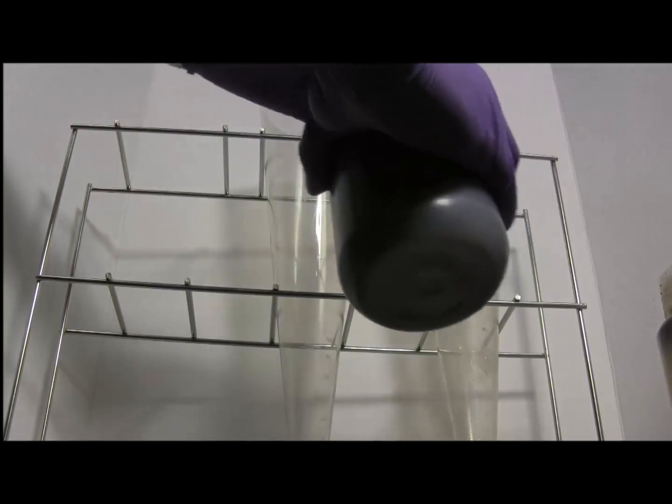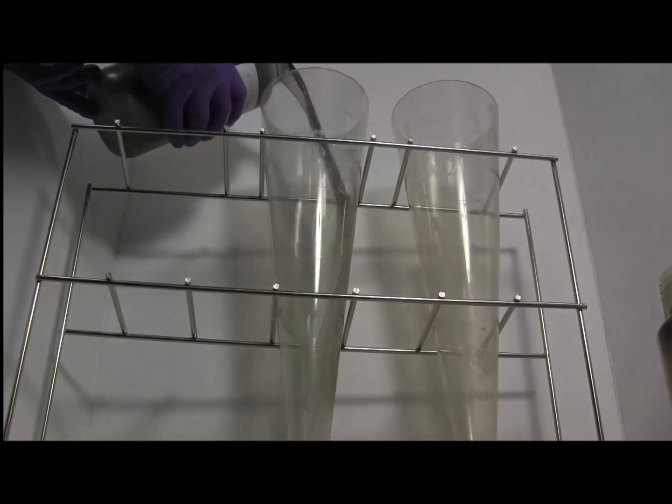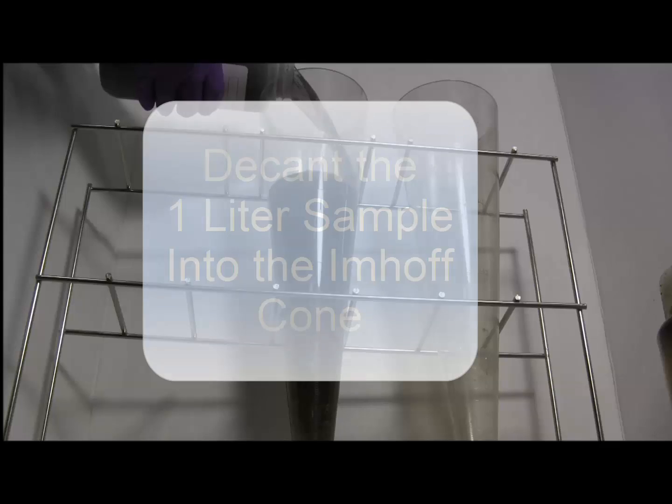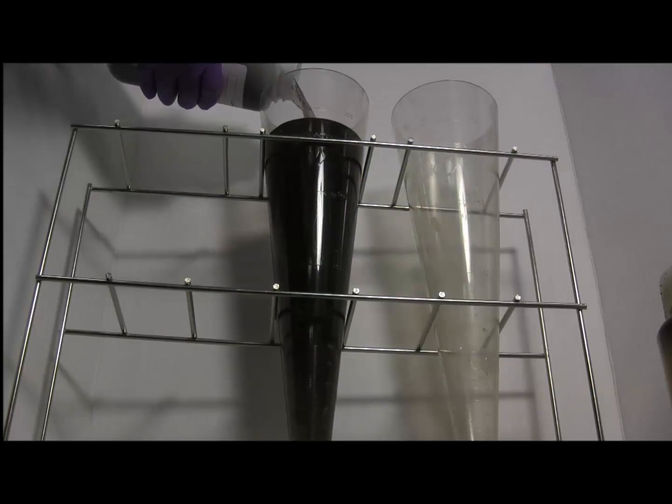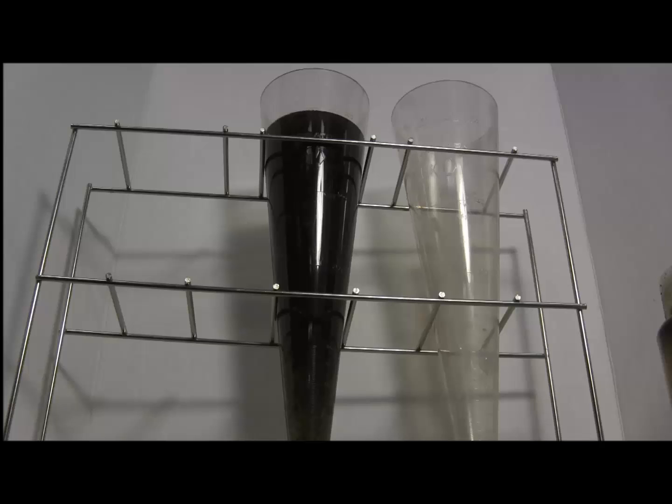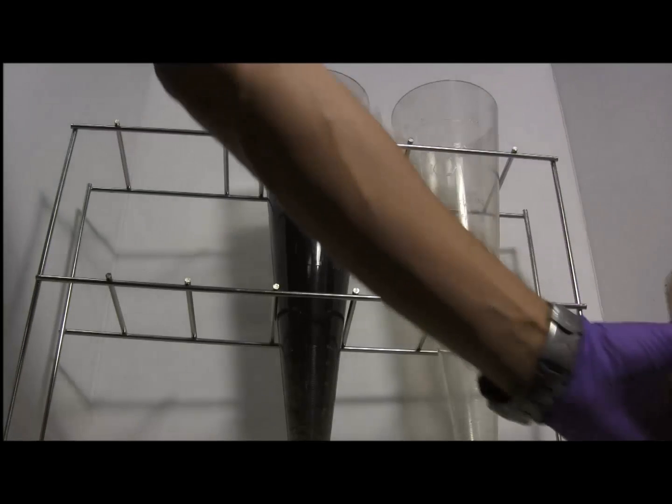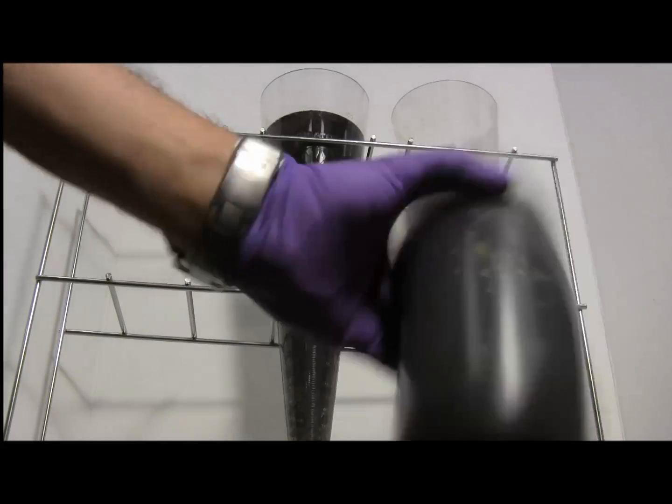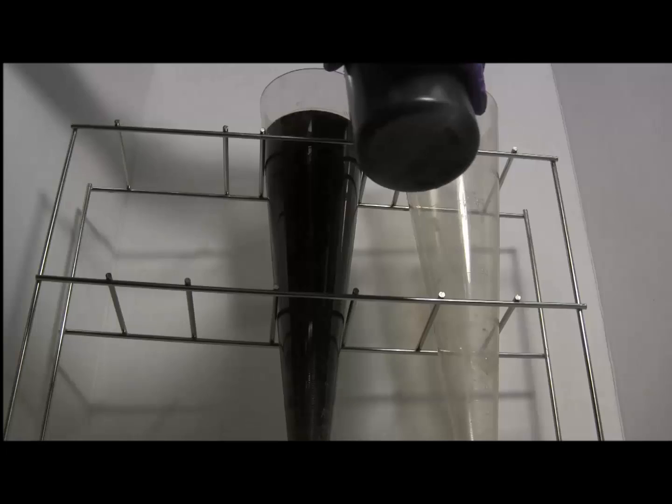Thoroughly mix your 1 liter sample and decant the contents into your Imhoff cone. A duplicate or replicate sample will be poured into the Imhoff cone adjacent to the first one.